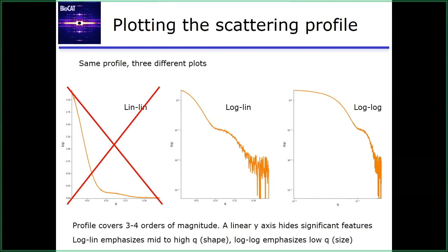The log-lin emphasizes the mid to high Q region. So this is the plot you want to use if you're trying to emphasize, say, shape or fine structure differences. The log-log emphasizes the low Q region. So this is what you want to do if you want to look for size differences in your sample. So they have different purposes. There's also a bunch of different plots that we use for particular analysis. But just generally speaking, if you're presenting a scattering profile and you're showing it in a group meeting, in a paper, in a presentation, or wherever, unless you're doing a particular analysis or you have some particular reason, it ought to be on either a log-lin or a log-log plot.